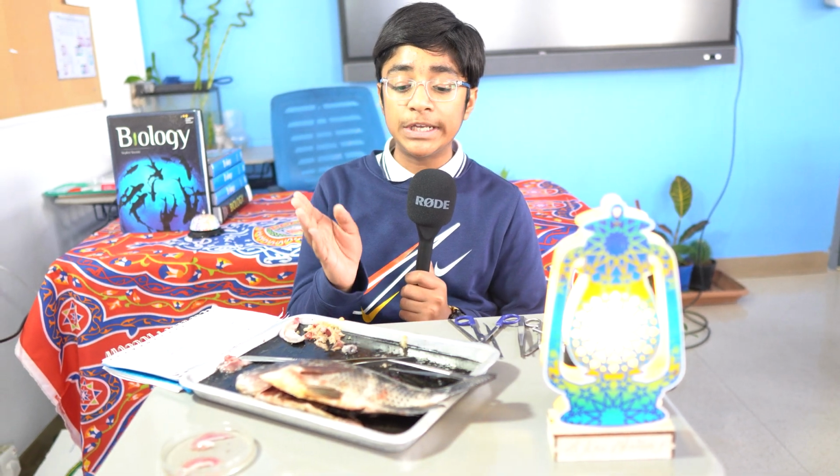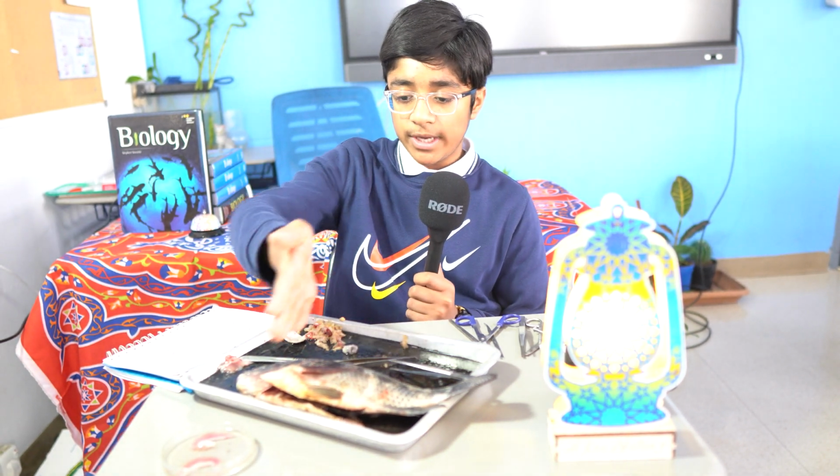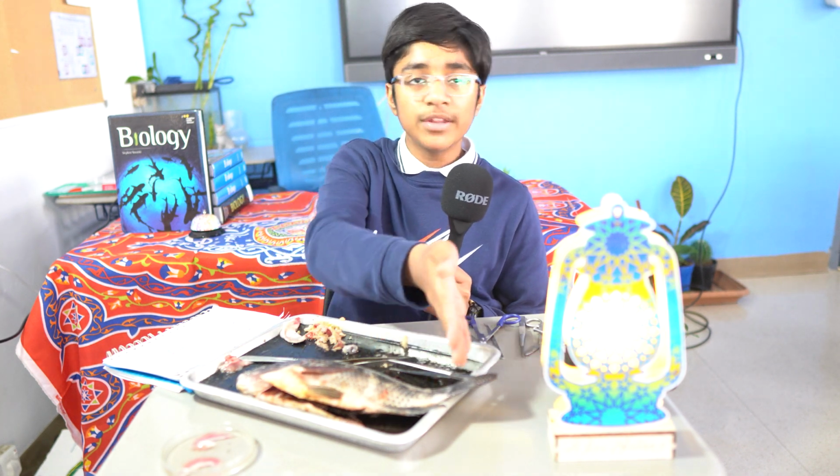Assalamu alaikum, my name is Muhammad Hamzah Naveed, and today I'm going to be talking in detail about the tilapia fish and many of its internal structures, which are extremely interesting. So, first of all, many scientists can classify this fish and divide it into three main sections: the head region, the trunk region, and then the tail region.